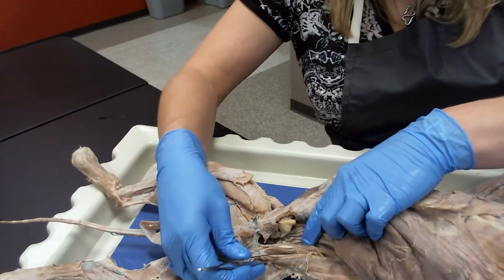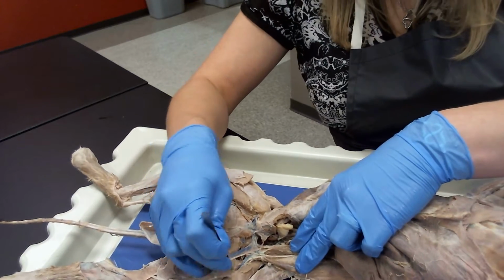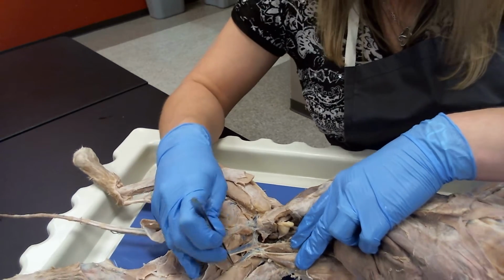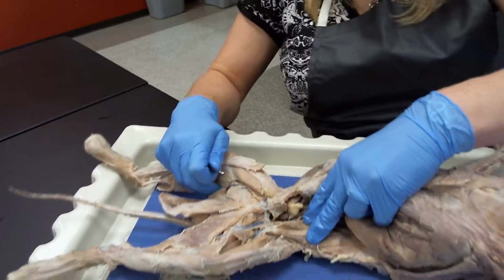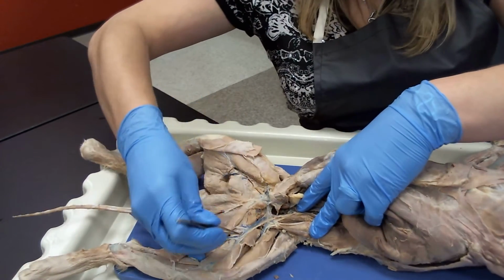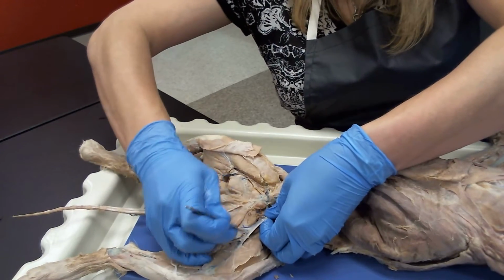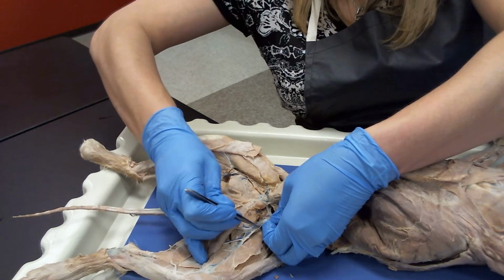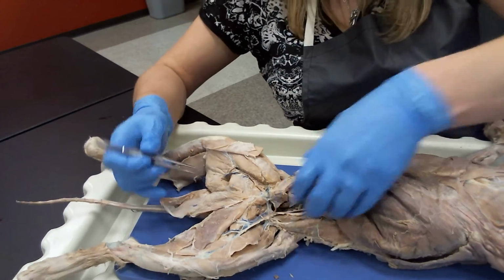You can appreciate it right there, really pretty, diving out of that muscle. Okay, now if you trace your femoral nerve on down, what you'll be able to see is he splits. Okay, he comes on here and he dives into your quadriceps muscle. Really nice. You can appreciate that. Dives into your quadriceps muscle, and then he has a branch that comes off of him that comes right down into this region and runs down next to your saphenous vein, and that happens to be the saphenous nerve. Okay, so saphenous nerve runs down right there.